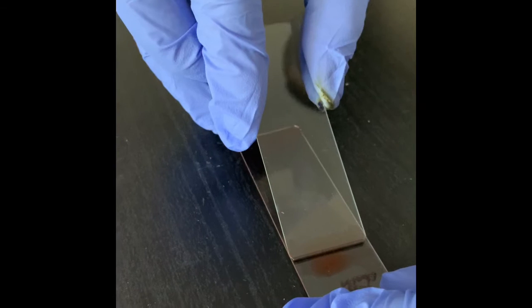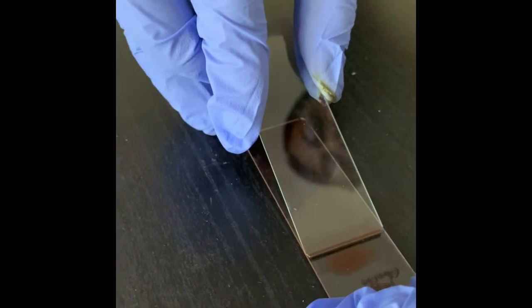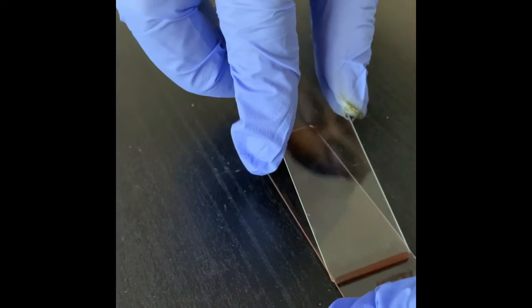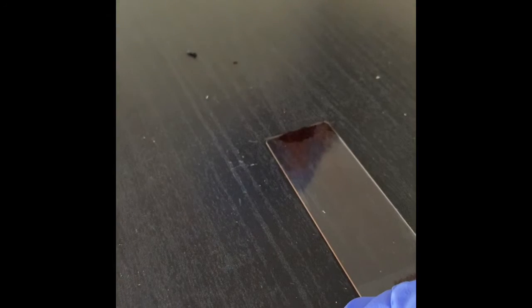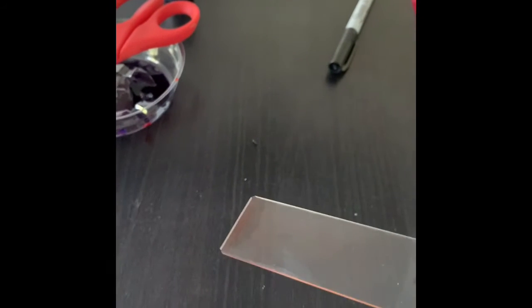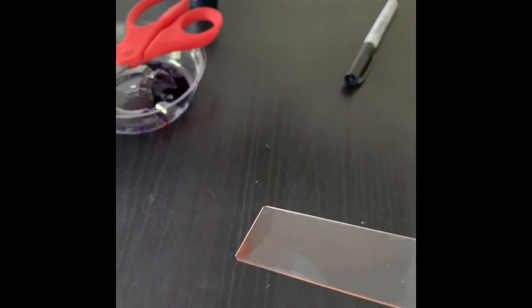Did you see that? Then with the Congo red and the material, I go back a little bit and then come forward like this. This is how you make the smear. Perhaps many of you have seen that this type of blood smear is made in the diagnostic lab.